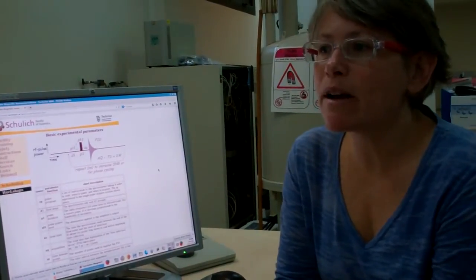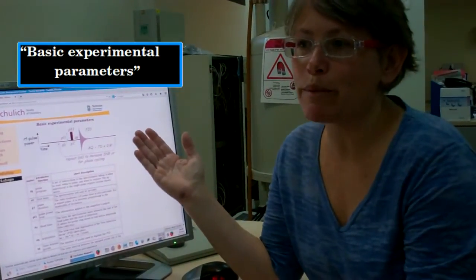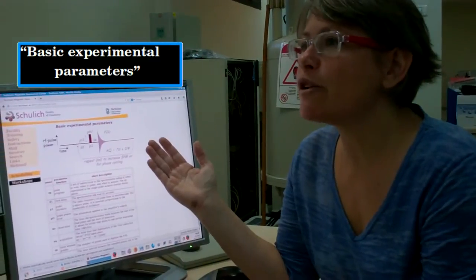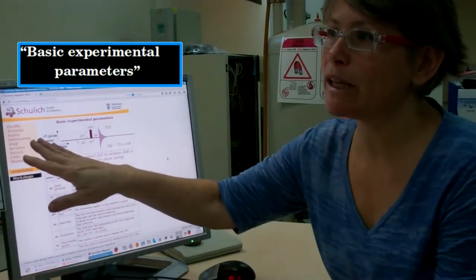In addition to a copy of the instructions, I recommend having a copy of the basic experimental parameters nearby, which you can find on our website under the main menu link for training.